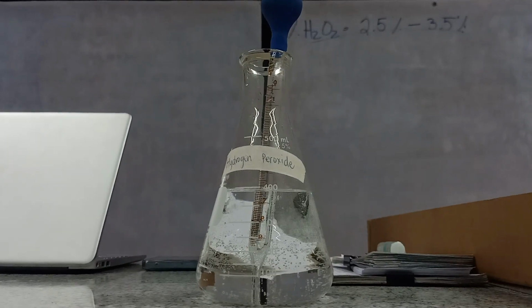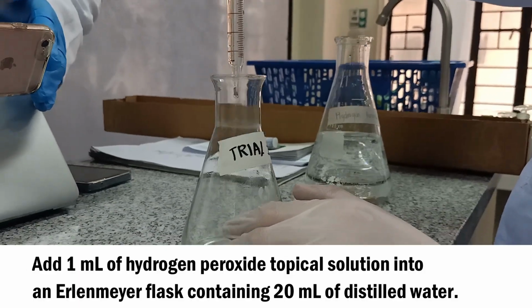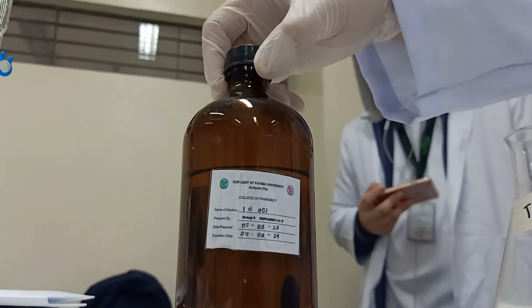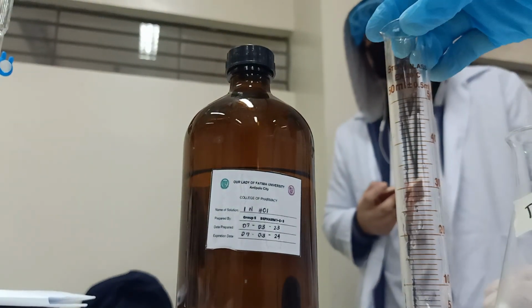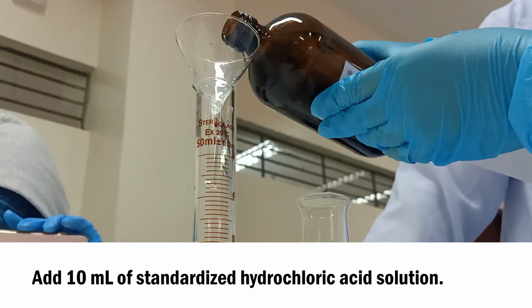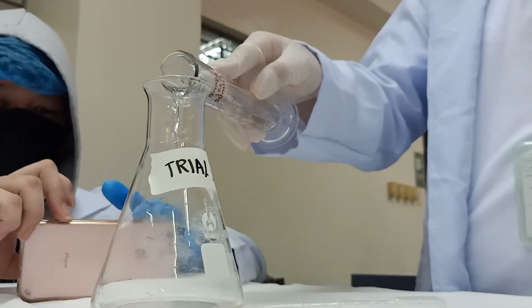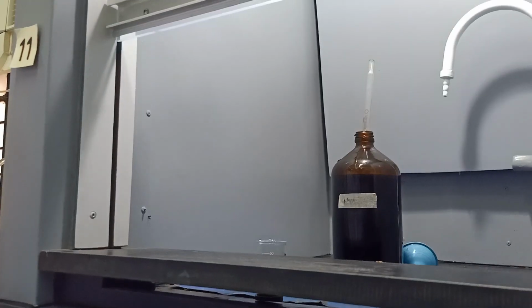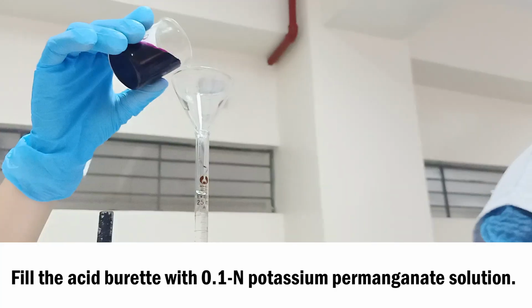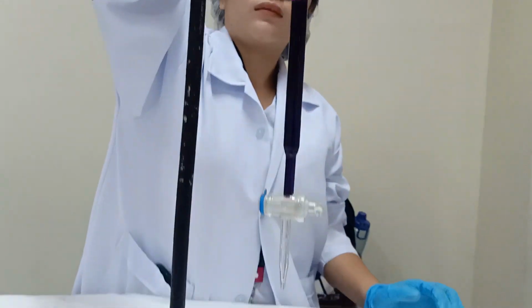Add 1 ml of hydrogen peroxide solution in an Erlenmeyer flask containing 20 ml of distilled water. Then, add 10 ml of standardized hydrochloric acid to further stabilize the chemical reaction. Potassium permanganate will be added in an acid burette until the 15 ml mark is reached.